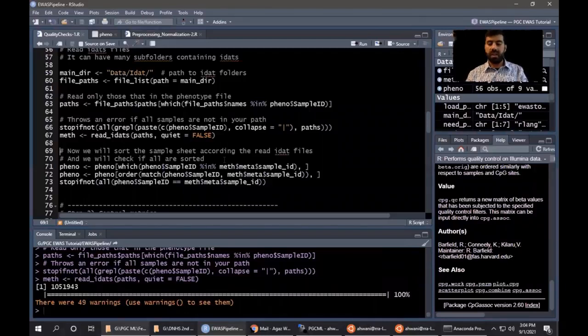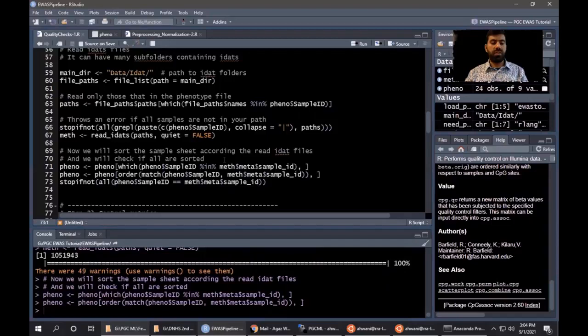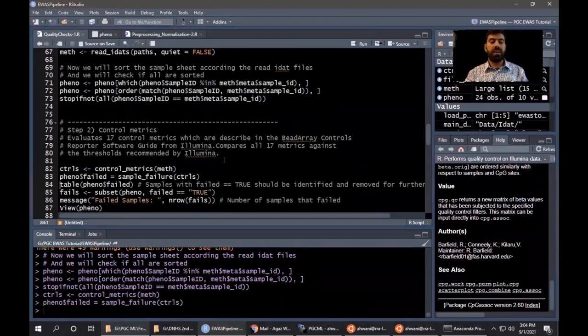Then we will check if we have all the samples on the sample sheet and the methylation data. So the next step we need to do is to evaluate 17 quality metrics that are recommended by Illumina. We will remove the samples that fail this check.